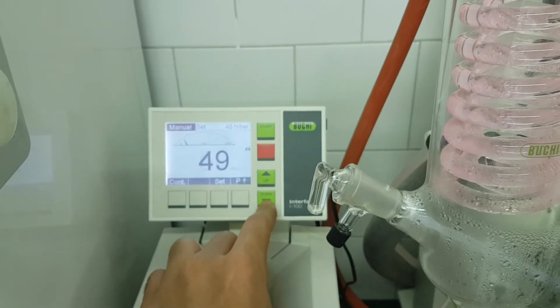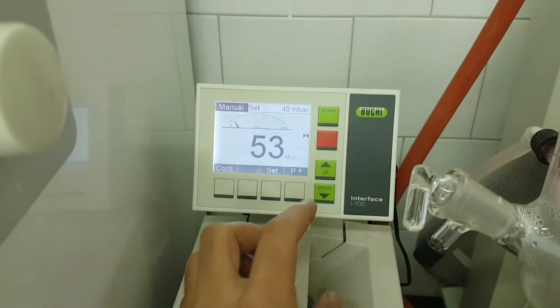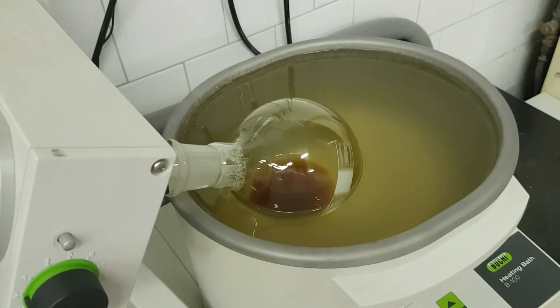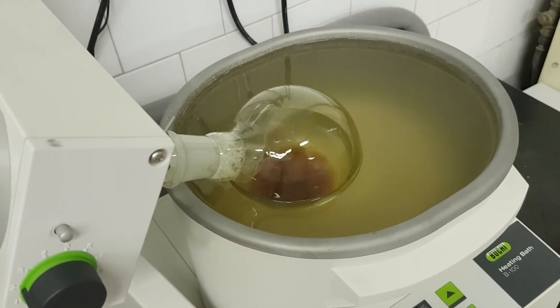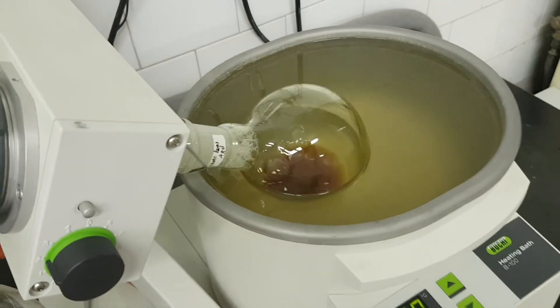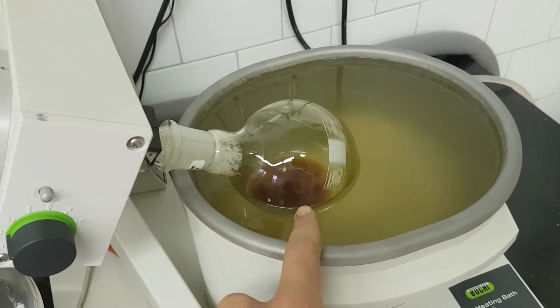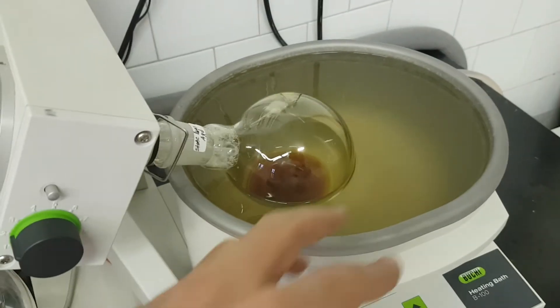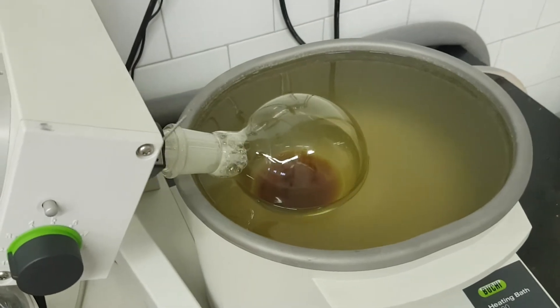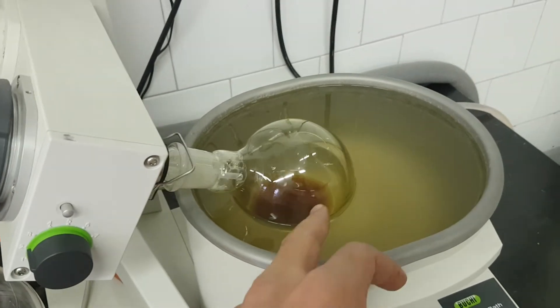You need to go very, very slowly. I will go down only by two — look, bubbles are getting produced here. When bubbles get produced, it might create a problem. You need to have only small evaporation bubbles like that.